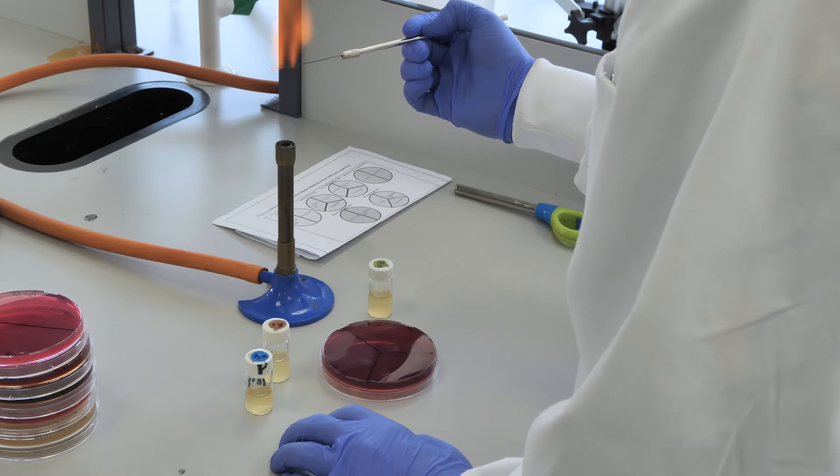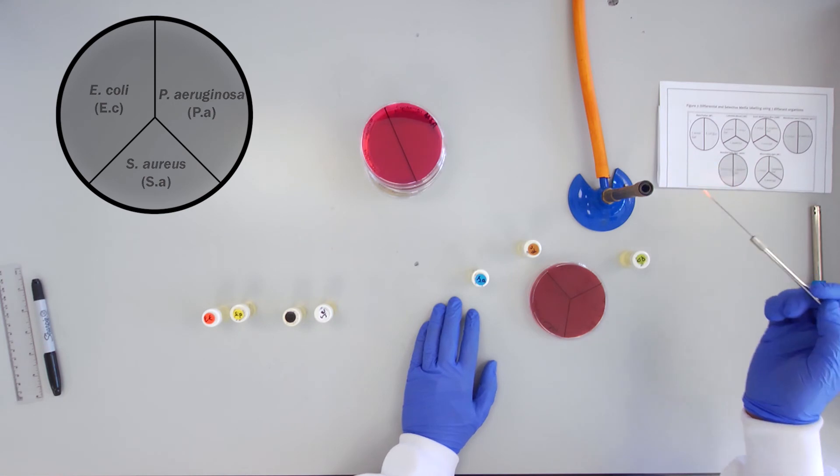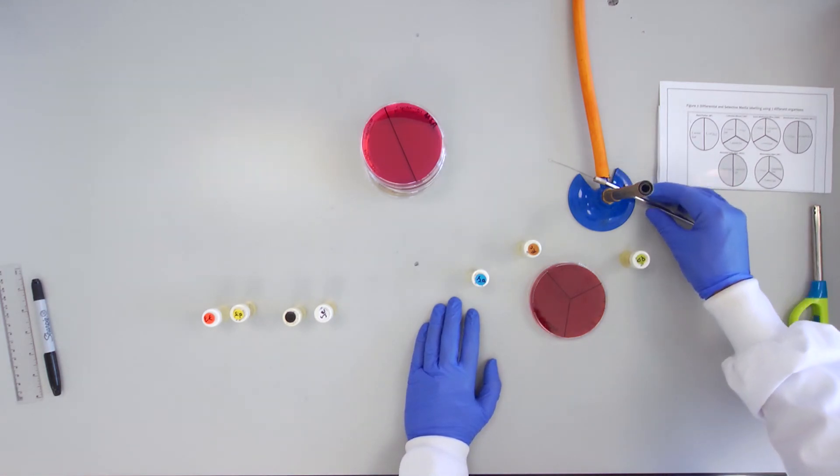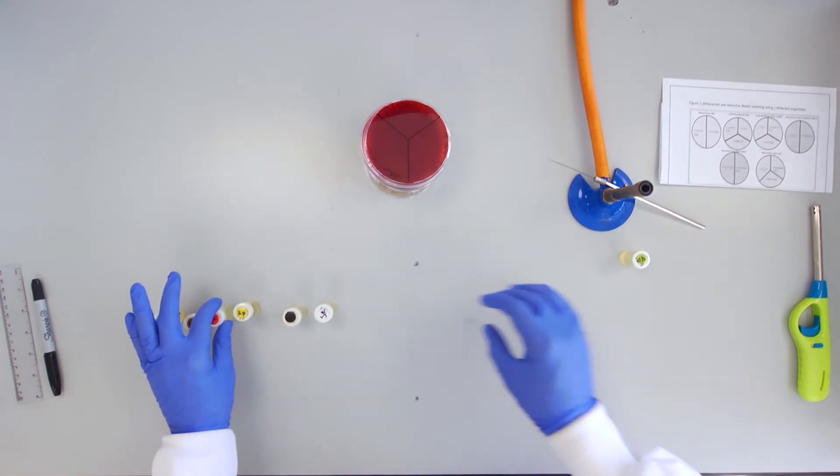Once complete, wrap and label the stack of inverted plates. These will be incubated at 37 degrees for 24 hours.